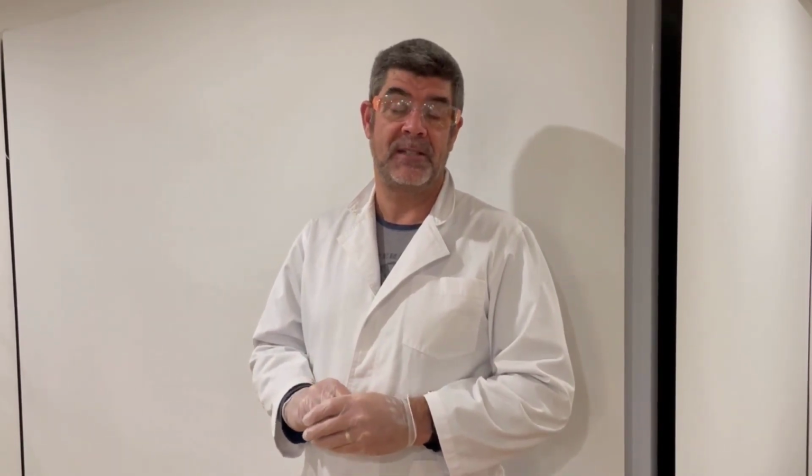So there it is, episode number 3, double displacement reactions, also known as the precipitation reaction. We produced a beautiful precipitate of copper carbonate, really fantastic. Have another look at the formation of that earlier in this video. That was a great precipitate. But we haven't quite been able to get the exact bang-on results that we would have expected. But this is science, and sometimes we need to review our processes, we need to look at our procedures, and we also need to repeat our experiments.